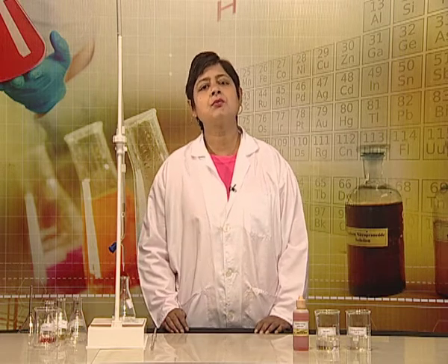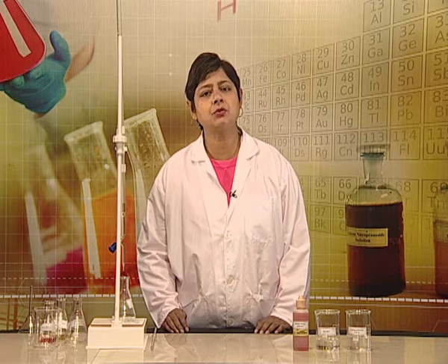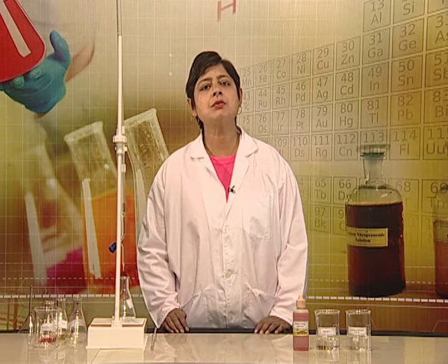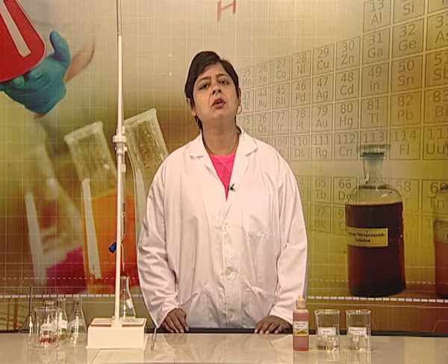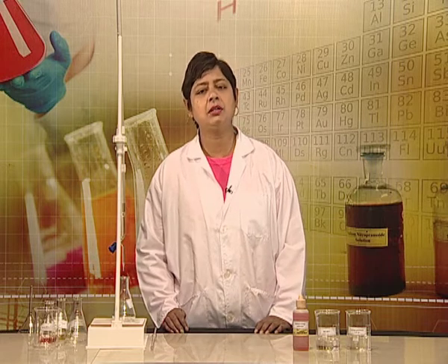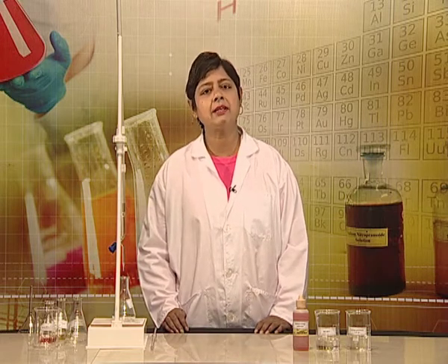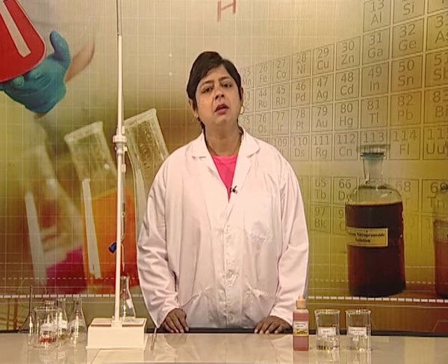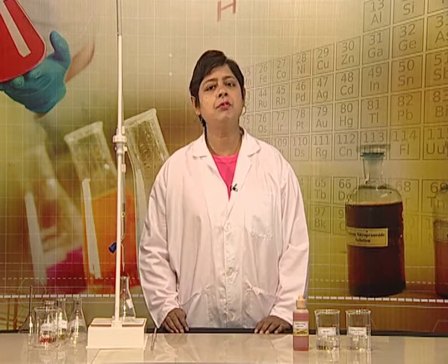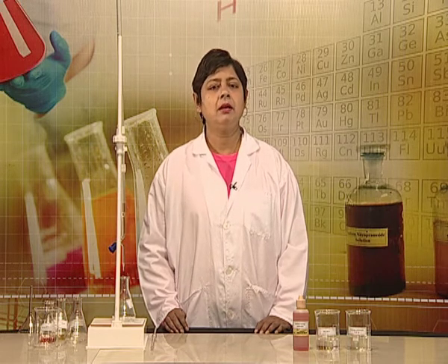We note down the volume of the hydrochloric acid solution used at the end point and use it along with the concentration and volume of sodium carbonate taken for calculating its concentration using the formula 2M₁V₁ = M₂V₂.